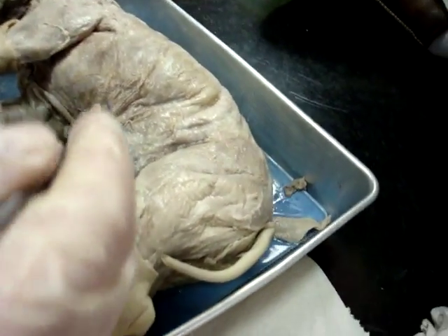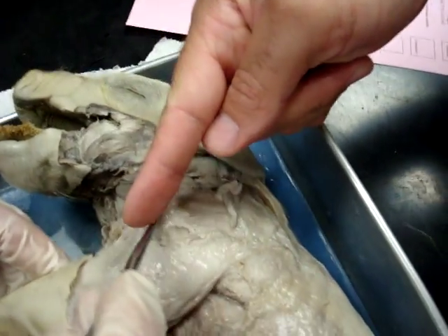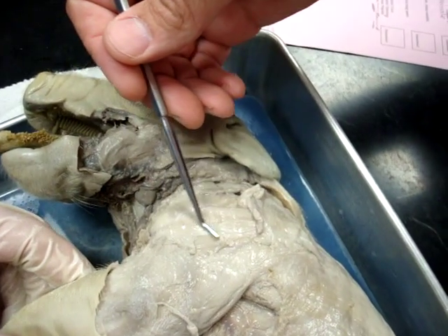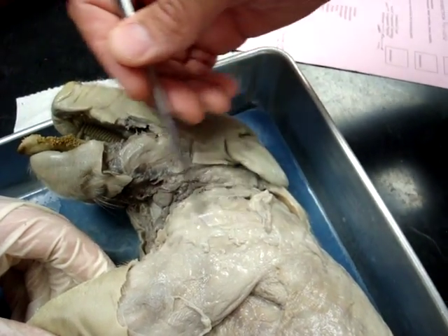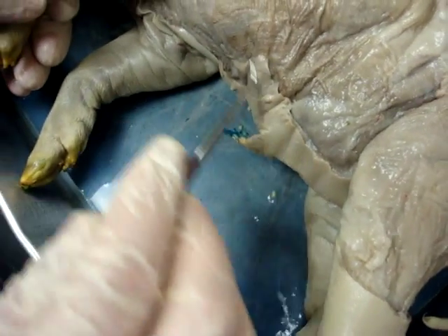Where's the deltoid? The deltoid is the shoulder — is that like up here? It's up further, it would be up here. Which you want to cut... I know we had like some membrane. I'd try to cut away as much as I could. It's more in this area right here, where it cuts into a triangle. So it would be right there in the front. Very good. External obliques — ab muscles. It's these ones down here. Very good.